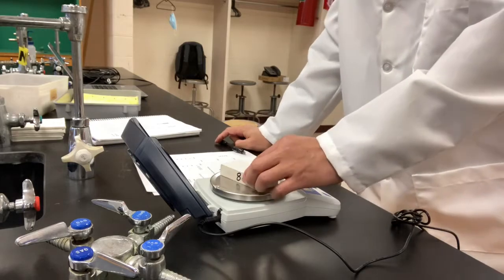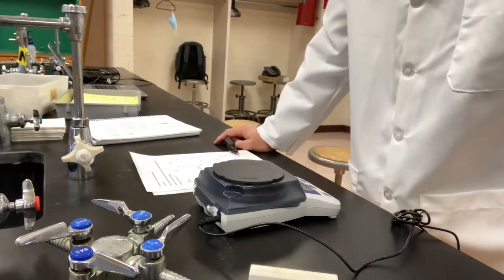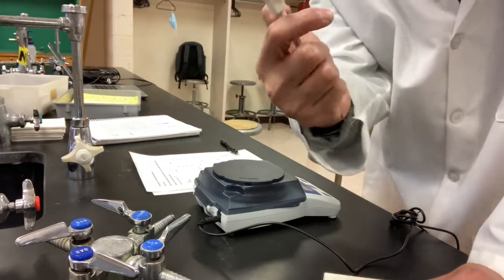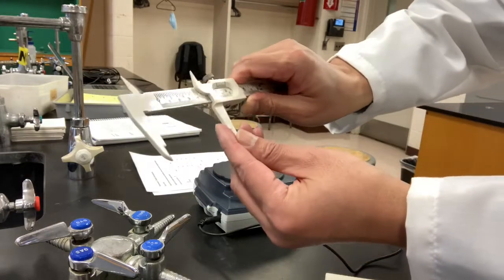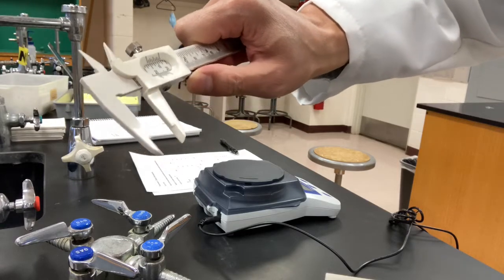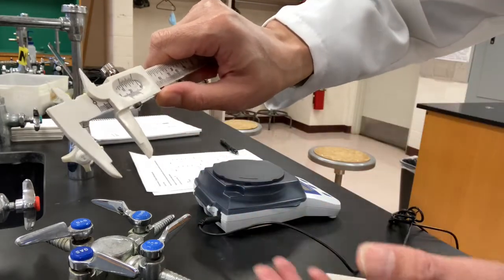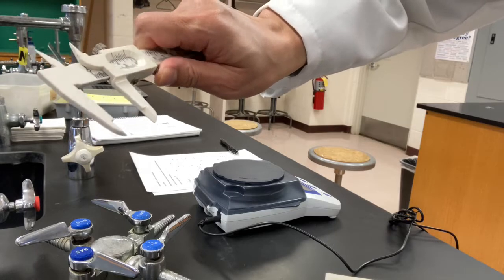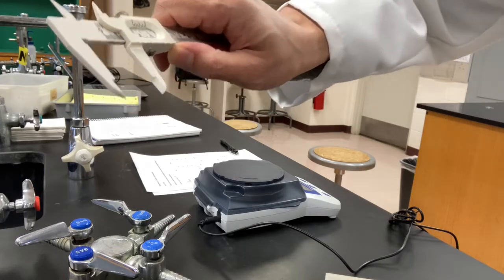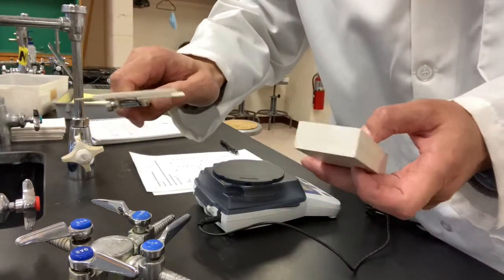Now, we're going to measure the length, width, and height of it. Well, normally we will use a ruler to measure it, but this time we're going to introduce a unique instrument. It's called a caliper. A caliper is used to measure the dimension of an object. It needs some time to talk about how to use it, how to read the number from it. But in this experiment, we're gonna skip that part. I'm just gonna use it to take the measurement. I'm gonna measure the length first.